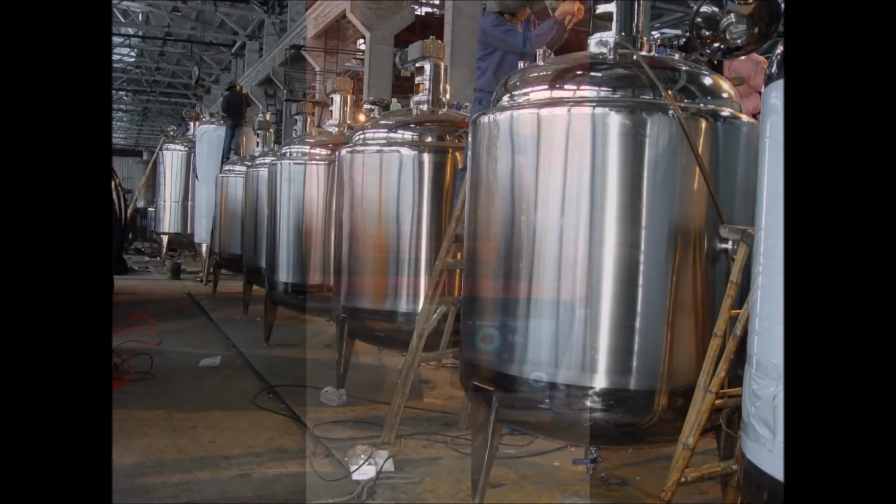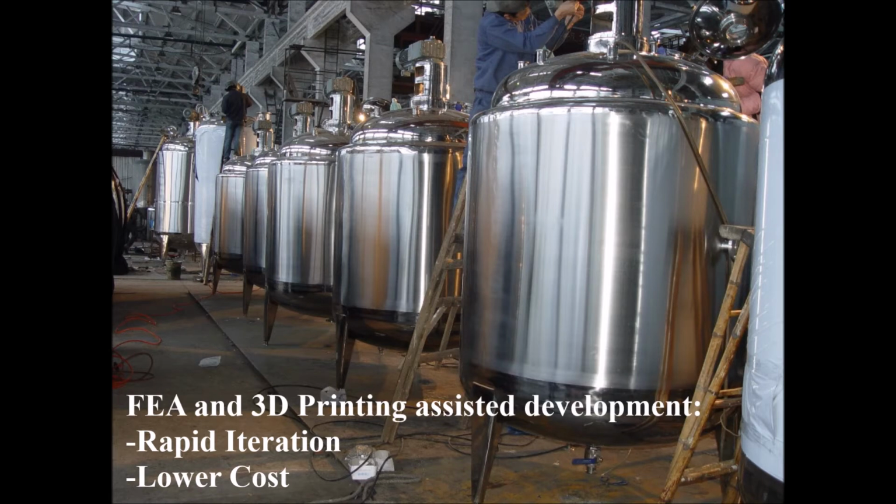Between COMSOL simulations and 3D printed models, new reactor designs can be rapidly produced and tested. Our group went through 2 designs to demonstrate this process.